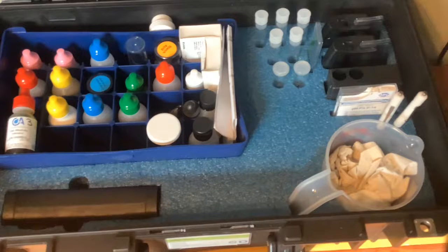Another great tip is to always have something with you to clean and dry your test kit supplies. Always thoroughly wash and dry your test vials at the end of each visit, as some tests can leave residual that can stick and become harder to wash away.